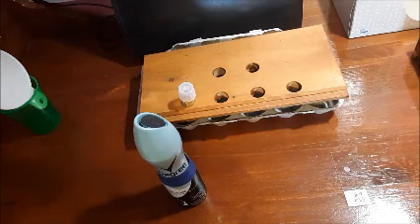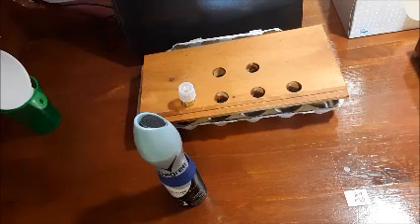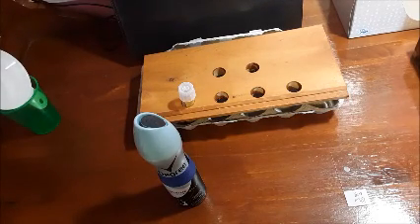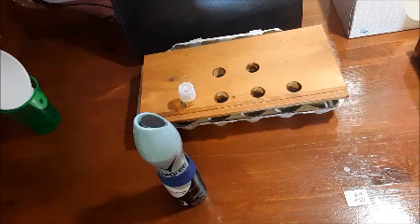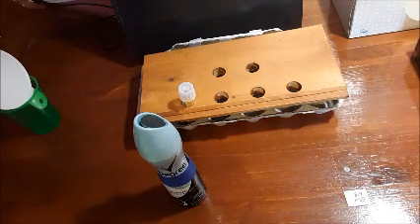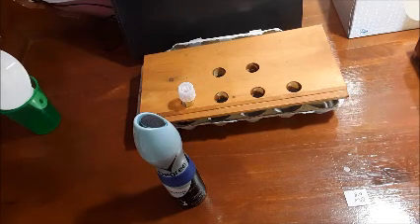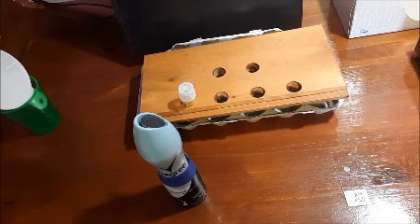And the reason why we actually heat fix the smear is so that the bacterial cells stick better to the surface of the slide. Now, for this experiment, you're going to need more than one slide that has a smear on it. So you're going to repeat the steps from where you took the drop of water, put it on the slide, obtain the culture from the test tube, and all that, and do it on another slide. So you have 2 heat fixed slides, because later on in this experiment, you're going to need these 2 slides for an acid-fast stain and an endospore stain.